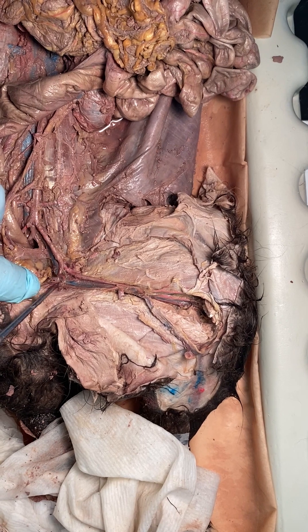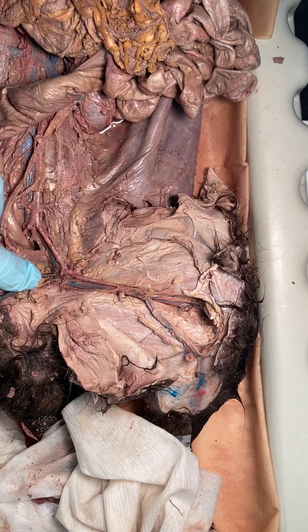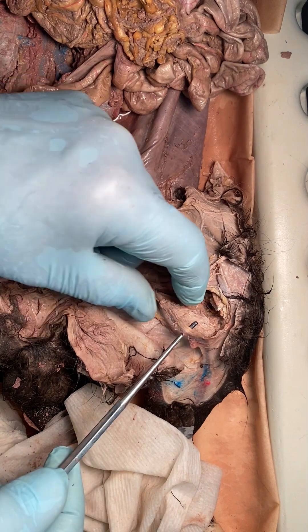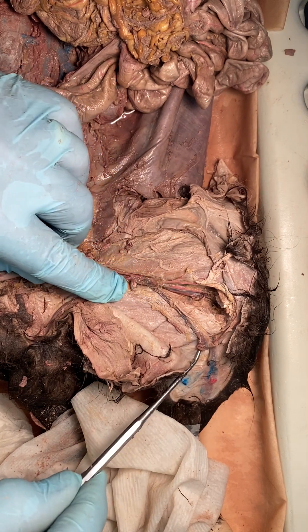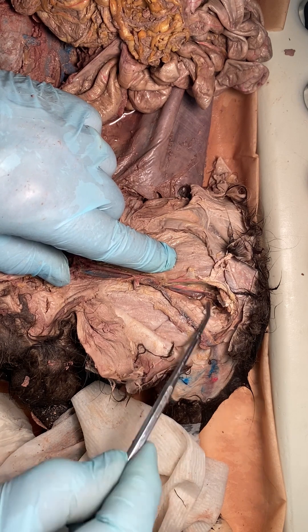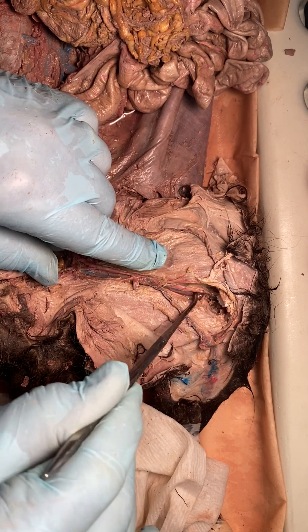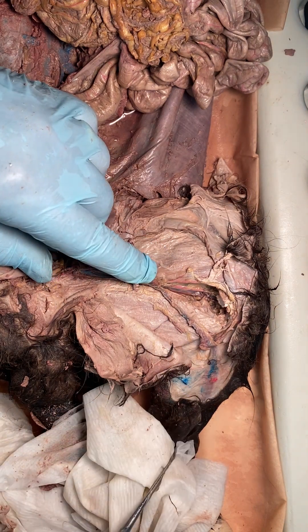Starting the dissection down the leg: as the external iliac is leaving the pelvic cavity, you can feel the hip bone there. Right there is the deep femoral, and then this becomes the femoral artery. As the femoral approaches the knee, the vein is much larger than the artery. There's the saphenous, then the superior geniculate — 'geniculate' means knee — and then the popliteal, which goes all the way to the back of the knee.